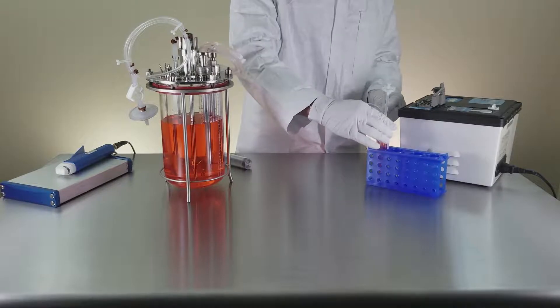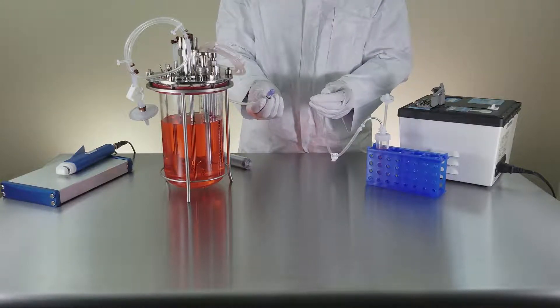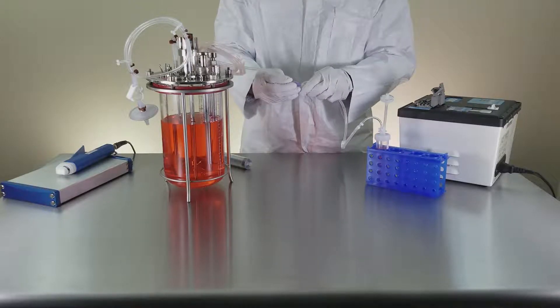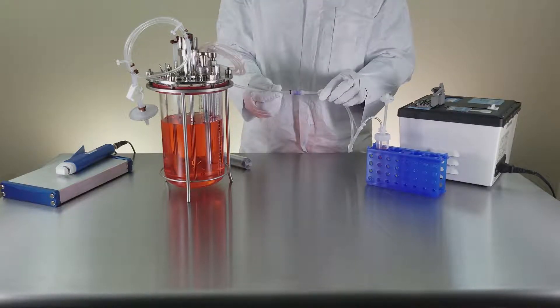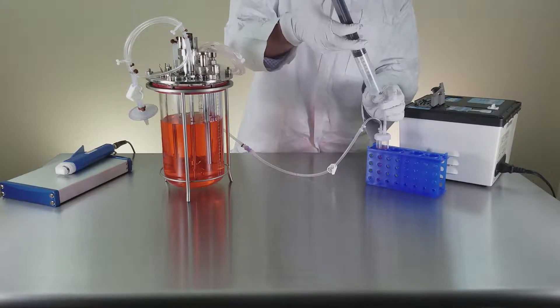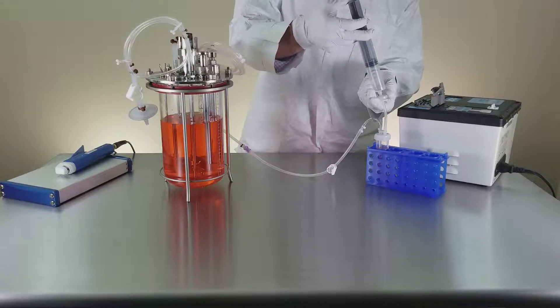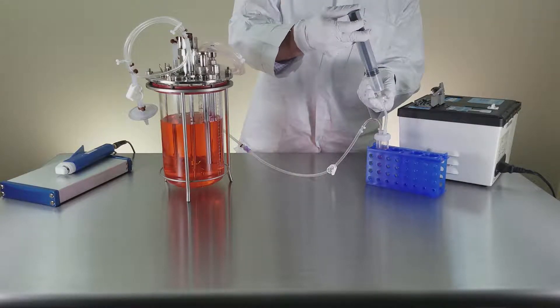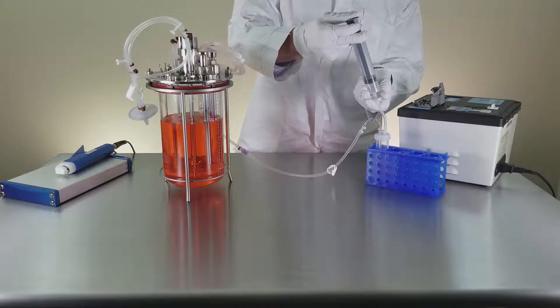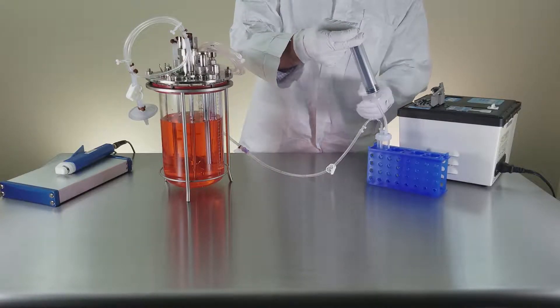Omnitop tubes are also excellent for performing small volume additions into your bioreactor, for operations such as inoculations or anti-foam additions. By simply pushing on your non-sterile syringe, air will be driven into the Omnitop, pressurizing it and driving the precise sample volume into the bioreactor with 100% recovery.